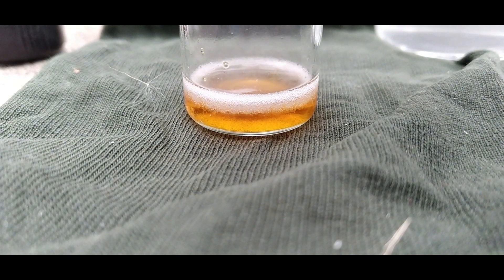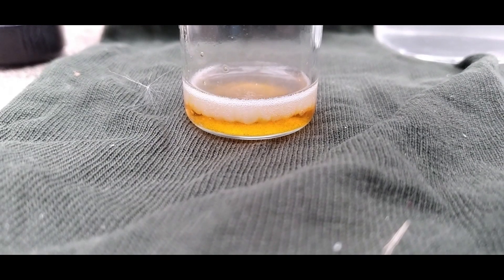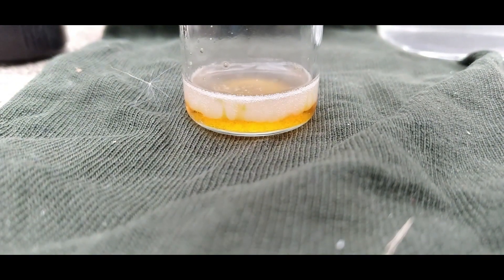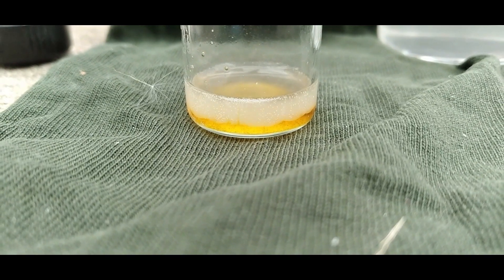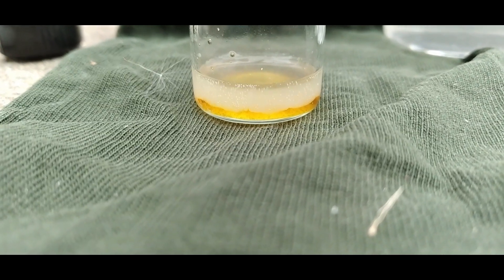Unfortunately, however, this compound isn't going to last because the sodium osmate was dissolved in bleach and this reaction also produces chloramine. While chloramine is not a particularly strong oxidizer — in fact, it's even weaker than regular chlorine — that doesn't matter because this compound of osmium oxidizes very, very easily.